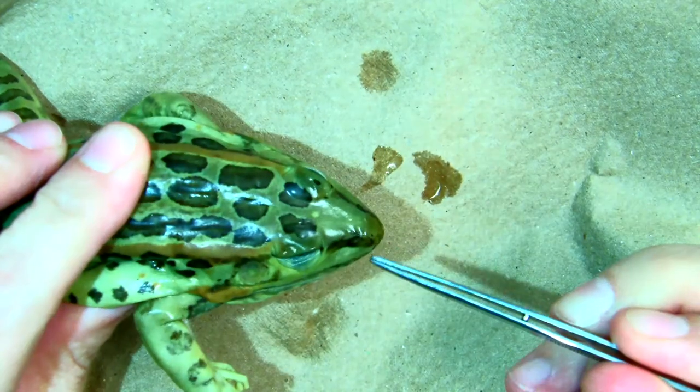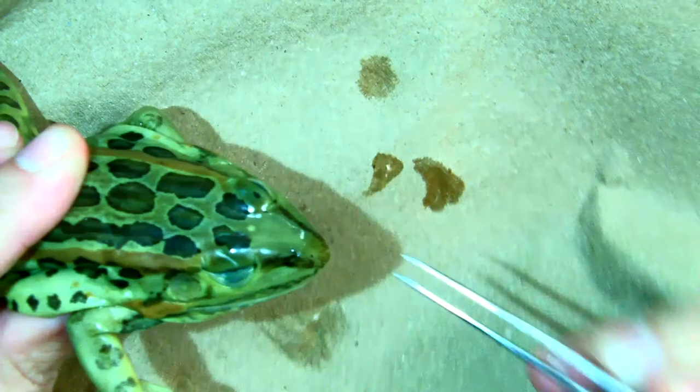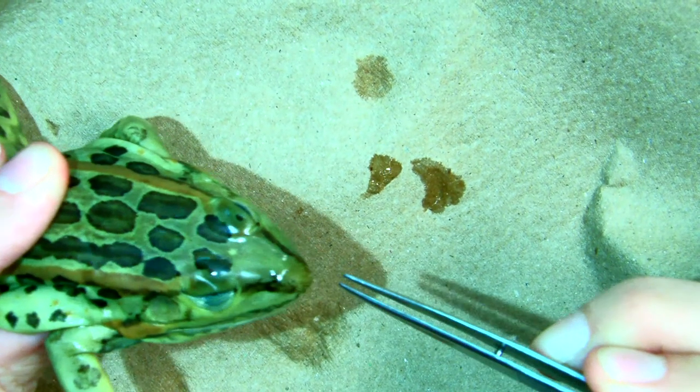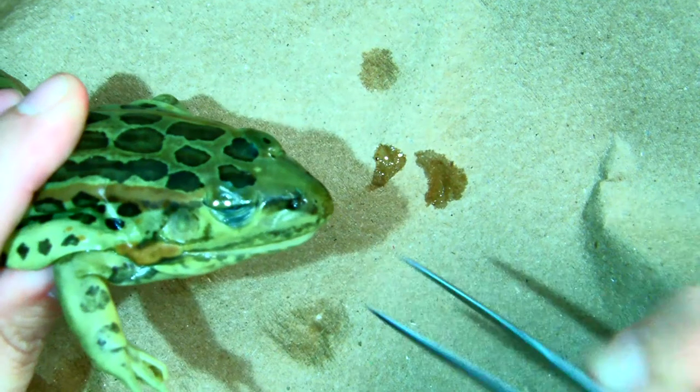We have our external nares. They're little holes right up here in the front. They're their nostrils. External nares. Sometimes it's easier if you just feel for them.